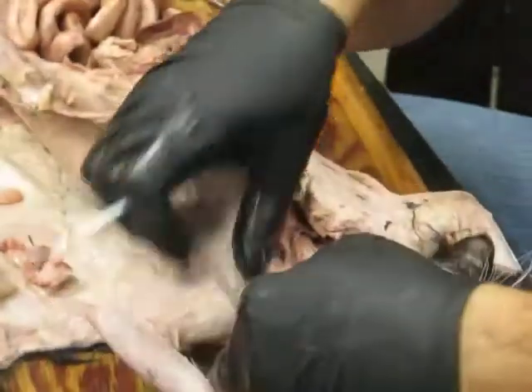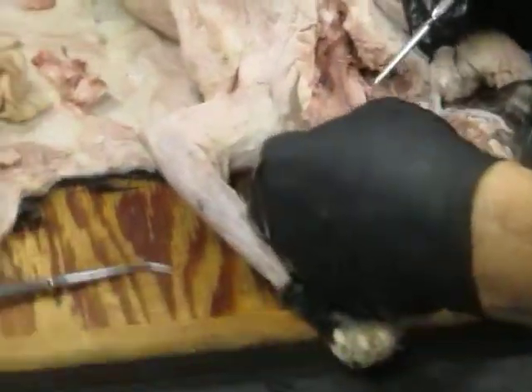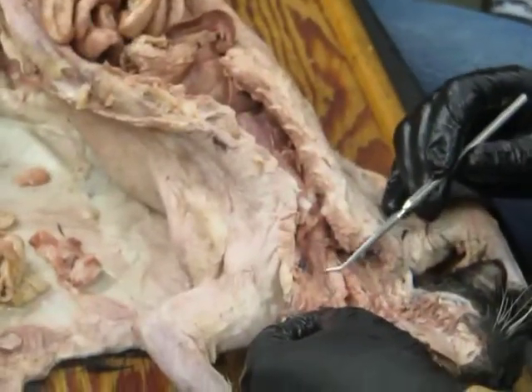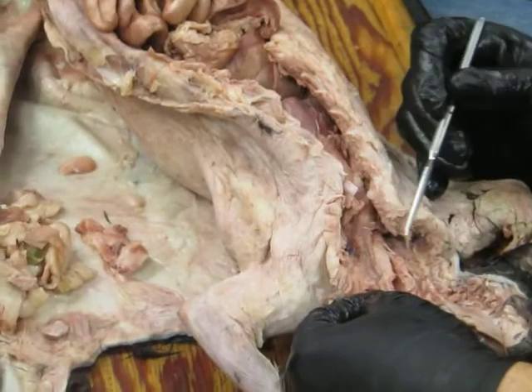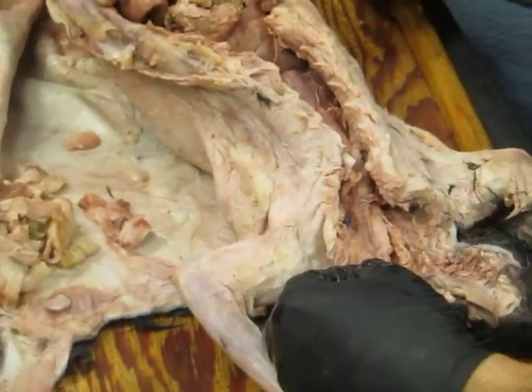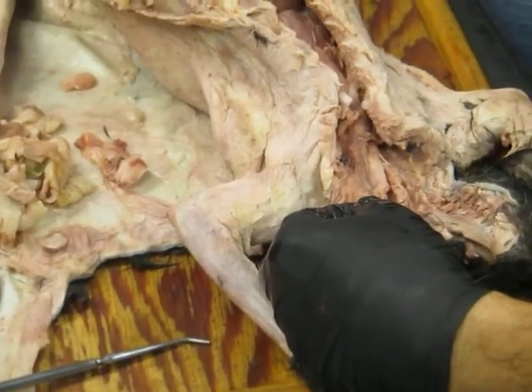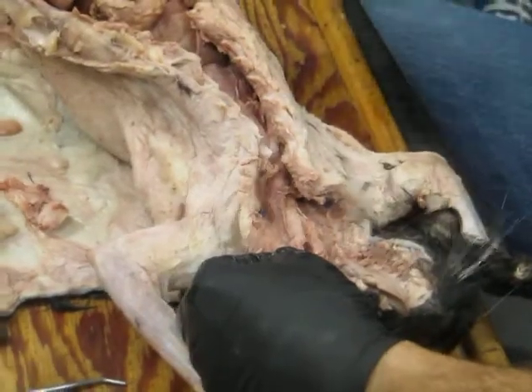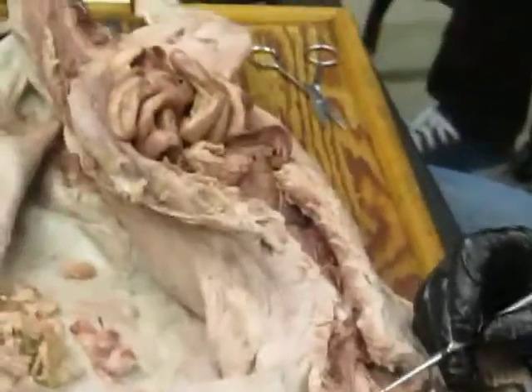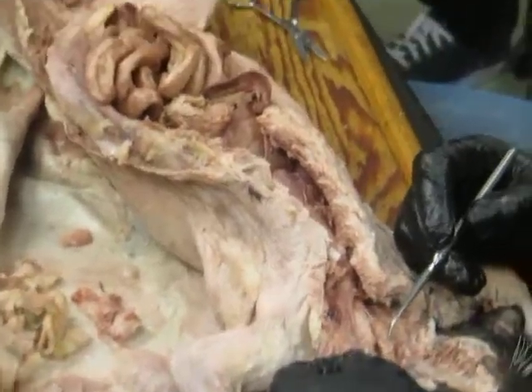If we kind of open up here the airway, you'll see there's this section here that's the trachea. And the trachea has cartilaginous rings around it, always in amniotes. There's going to be cartilaginous rings around the trachea, and that basically keeps it from collapsing when the animals are breathing in. Up above that, this is the region of the larynx, and there's a system of cartilages that support the larynx.